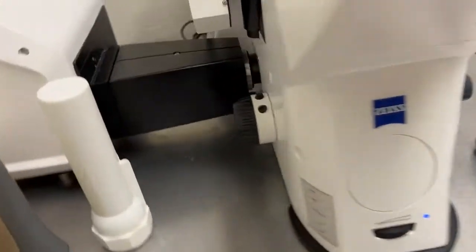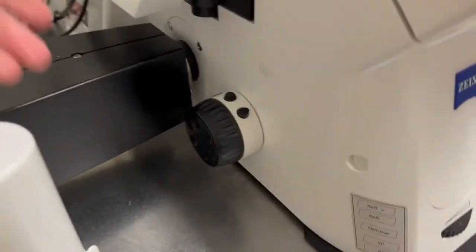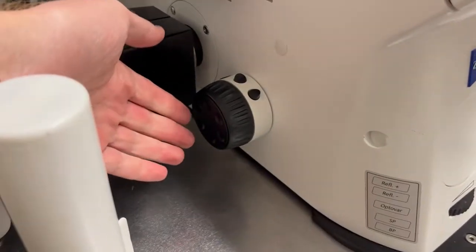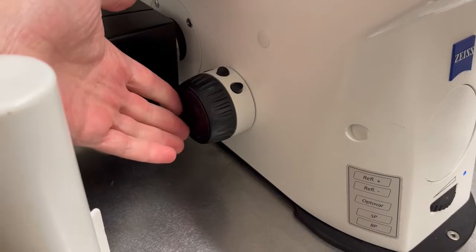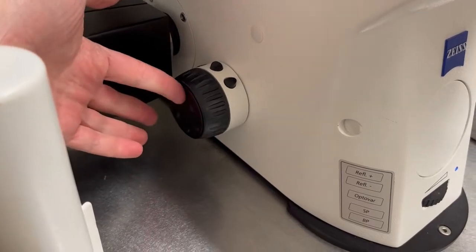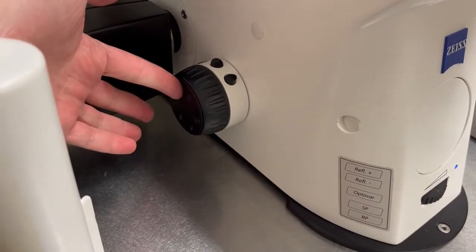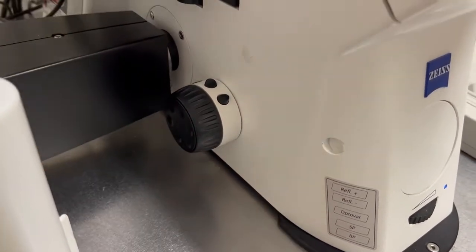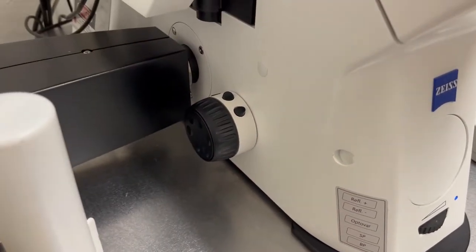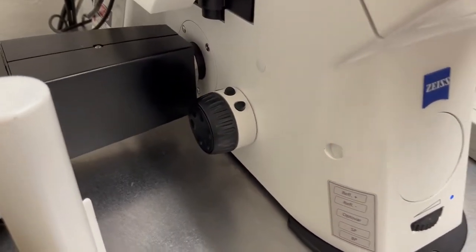On the left-hand side, you'll see that there is no inner knob, but there's this plate with divots that you can turn, and that is the fine focus on the left side.